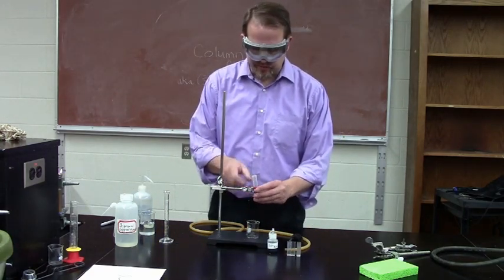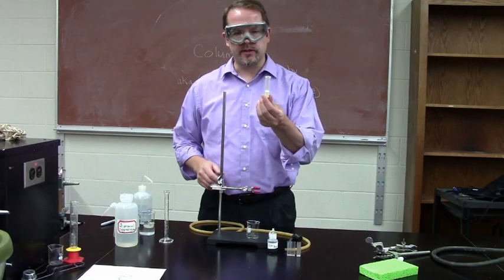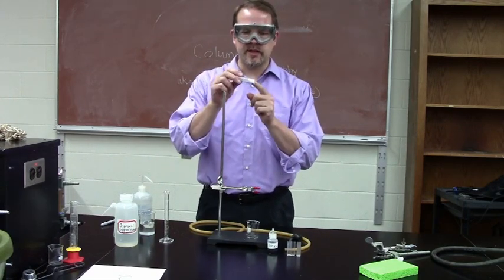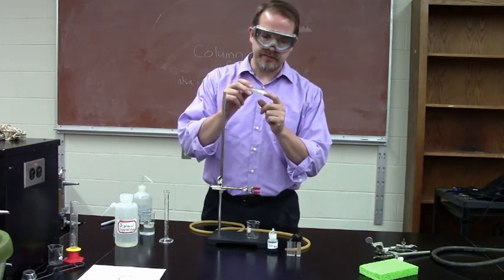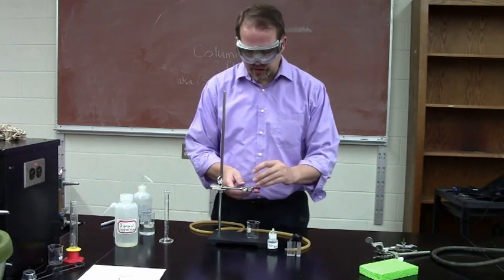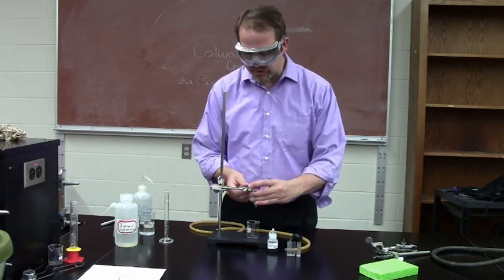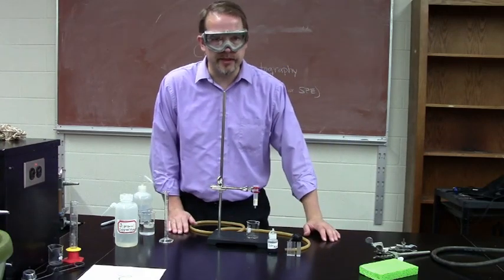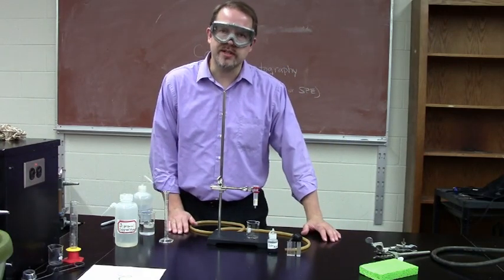We'll be using for our column this little thimble. It has a material that's in here that's silica gel, it's kind of like a white sand, and it's been coated with a hydrocarbon of 18 carbons long, C18, and it gives it a hydrophobic coating which is nonpolar.